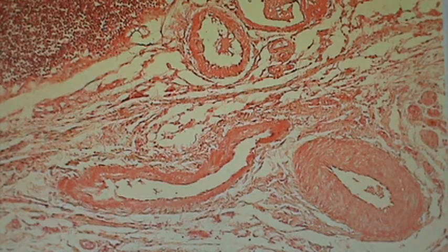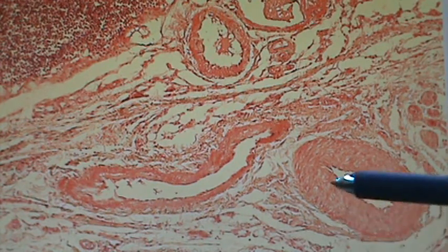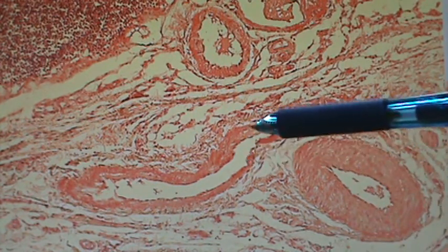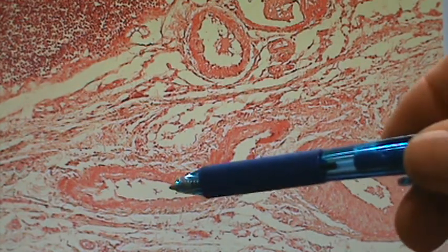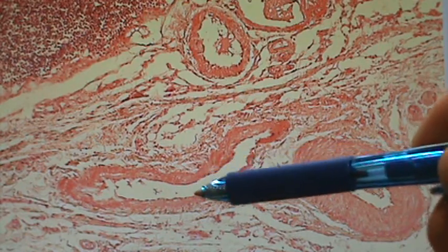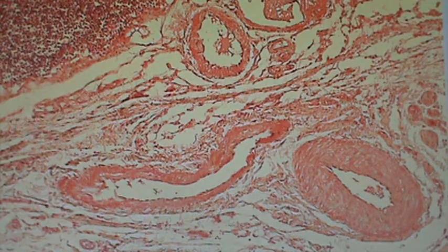Now let's look at some of these vessels that we have here. One of them, of course, is over here on the side. It's this one that you see back here. See that? Oh yeah, that's the artery again. See the really thick layer of smooth muscle? Now look over here, and you can see an entirely different one. This is a much thinner layer of smooth muscle, a rather large lumen, and this is a vein. So it's a little bit different shape, different structure there. Okay. Alright, onwards.